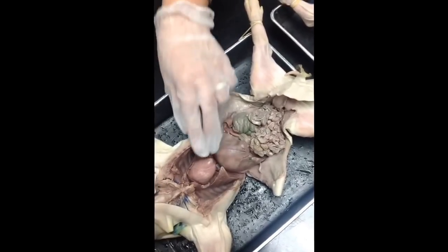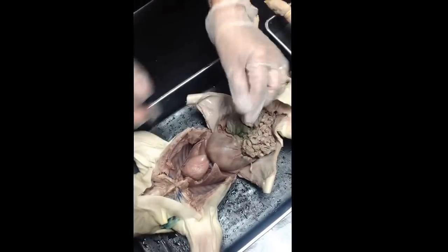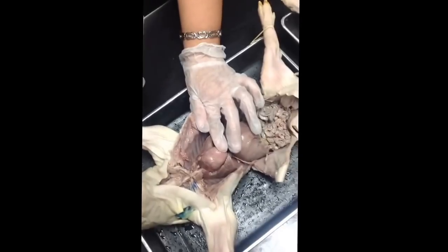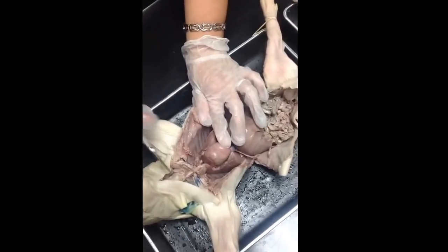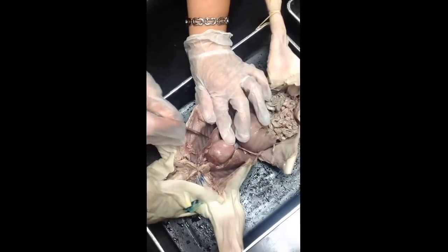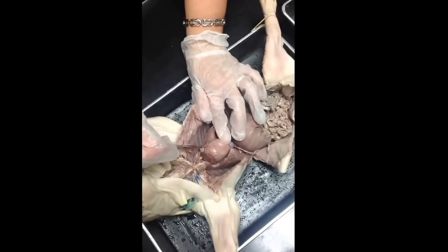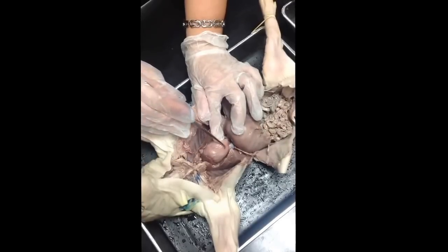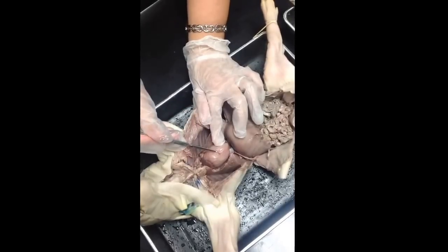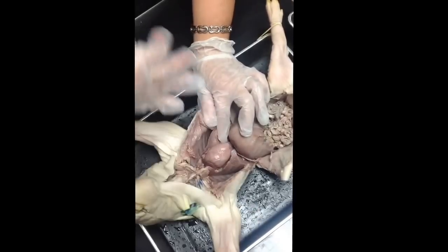Okay, for the cardiovascular system, that's the heart. Obviously, I'm not going to ask that. That's too easy. However, I may ask you about the different chambers of the heart. And so you can tell where the chambers are based on this external landmark. These are the auricles. So under this flap is your right atrium, left atrium. You can also tell your left from right ventricles by looking at this blood vessel, your anterior interventricular. So here's your right ventricle, left ventricle. So the pig's right, the pig's left.